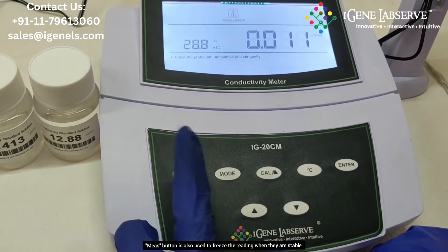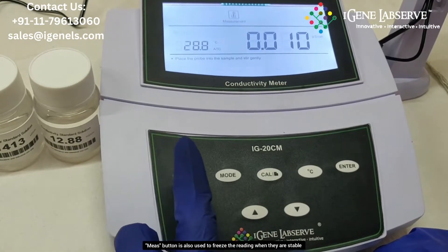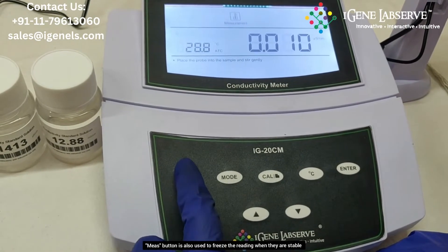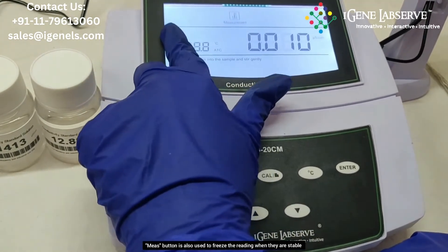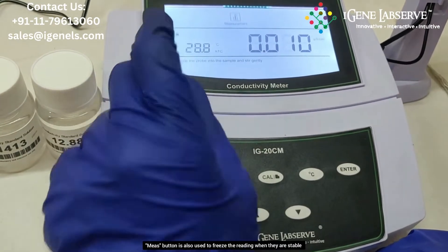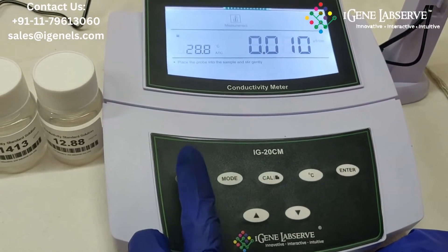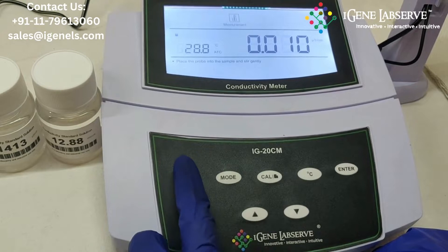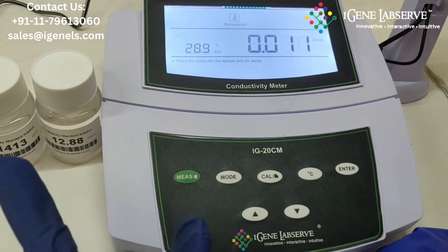The second function of the measure button is to freeze the readings. Press this button and the readings freeze. To release the readings, press the measure button again.